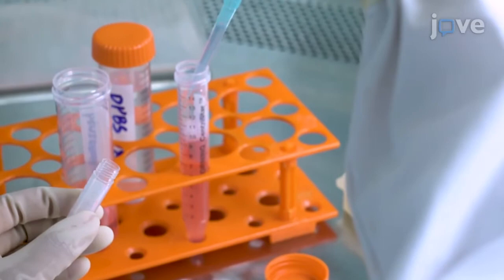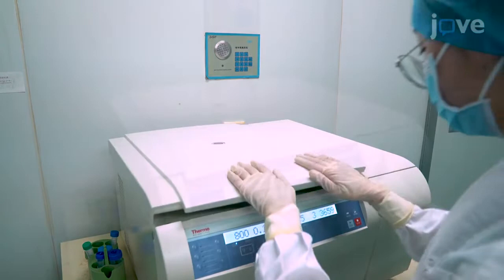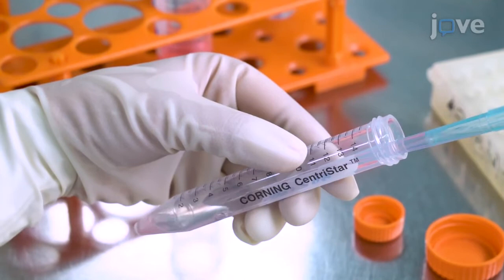Then centrifuge the tube at 400 times G for 10 minutes. Remove the supernatant and loosen the pellet by tapping the tube. Gently re-suspend the pellet in 1 mL of warm Benzonase RPMI 1640.